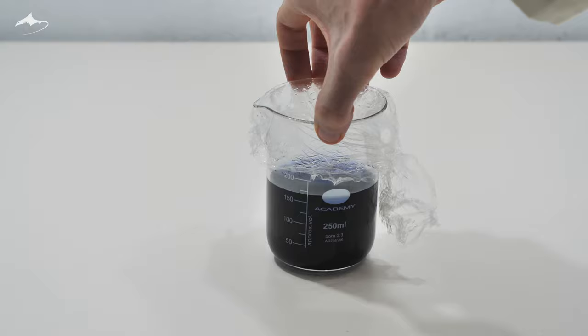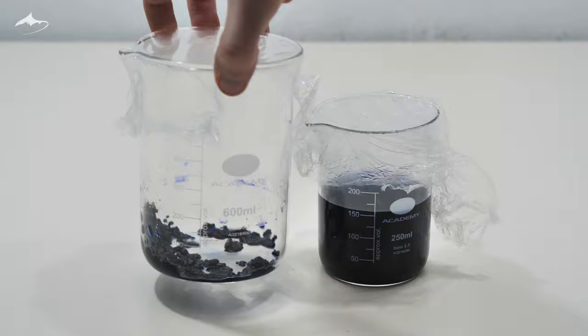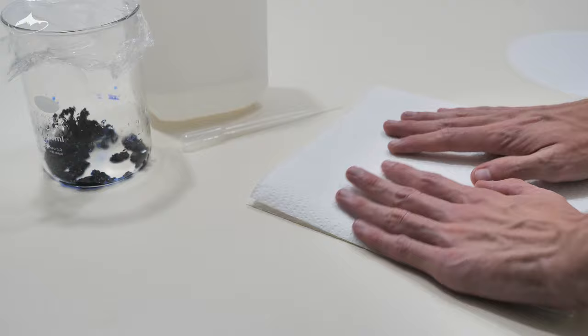As I mentioned earlier, a total of 150 milliliters of solvent was needed to dissolve almost 19 grams of salt, which is roughly a ratio of one part of salt per eight parts of solvent.